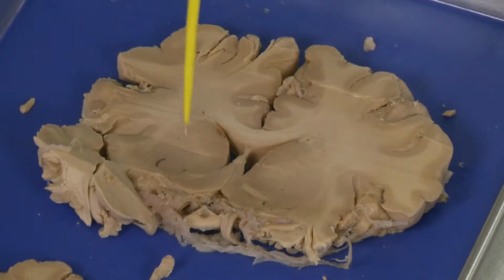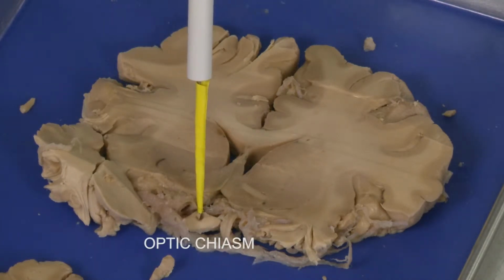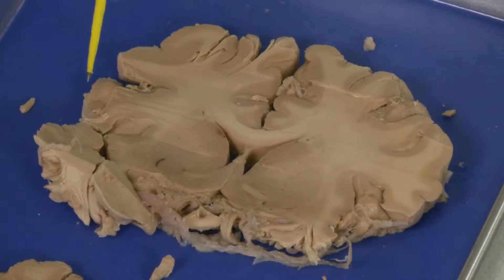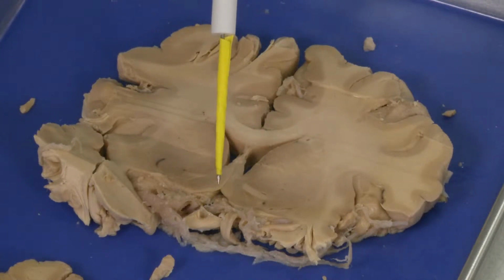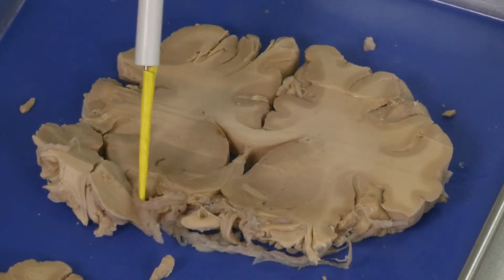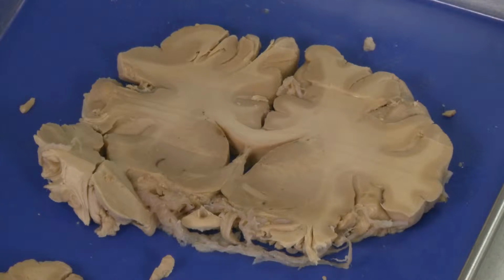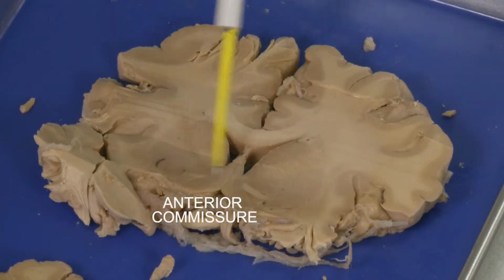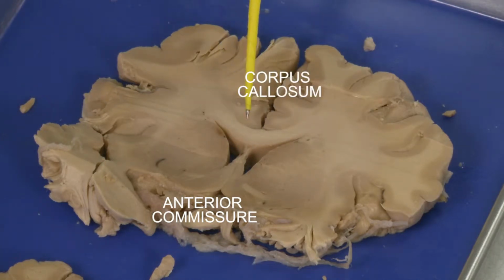Now we have cut through the optic chiasm. You cannot see it very well here, but in the ventral part it's the optic chiasm. To remind you, optic chiasm is the crossing of the optic nerve, and after crossing of the optic chiasm, the optic nerve becomes the optic tract. You can also see some blood vessel, for example, this is a middle cerebral artery. But what we can see very well here is a lot of basal ganglia, and another structure which is called anterior commissure. Anterior commissure is, similarly to corpus callosum, a bundle of axons which connect left and right hemisphere.